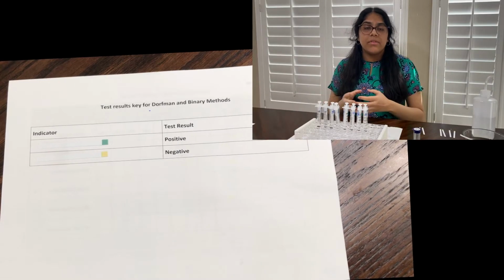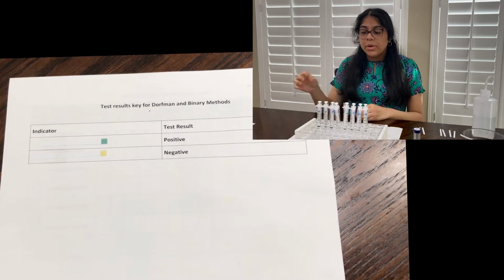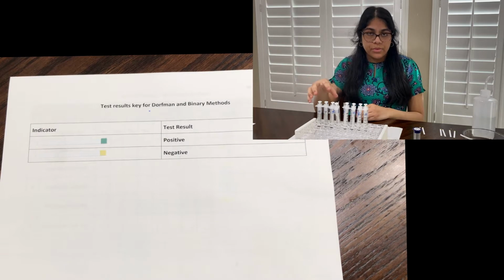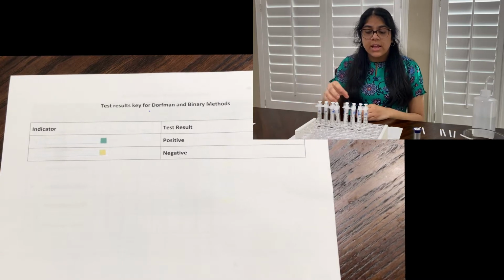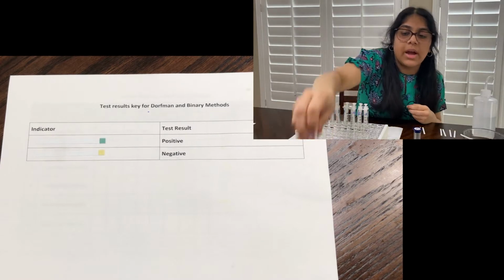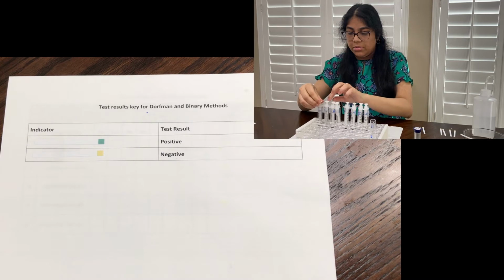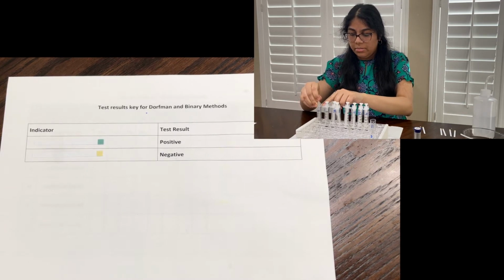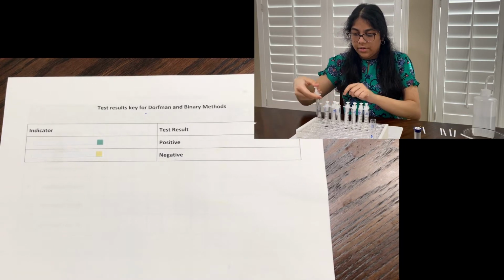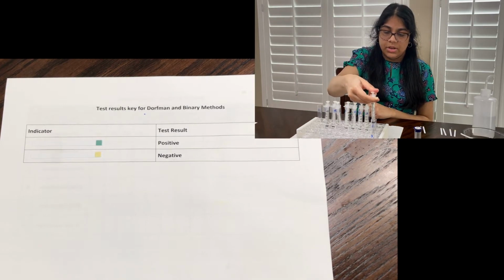So now I've filled up all of the individual test tubes, and I'm going to be creating 2 pooled tests. I'm going to put individual samples 1 through 4 in my first pooled test, and then individual samples 5 through 8 in my second pooled test. So I have a test tube labeled D1, so this is where samples 1 through 4 are going to go, and I'm taking about half of an ml and putting this into the pool.